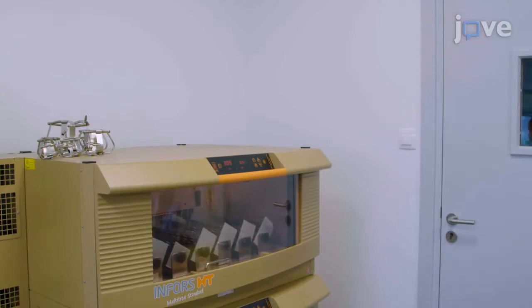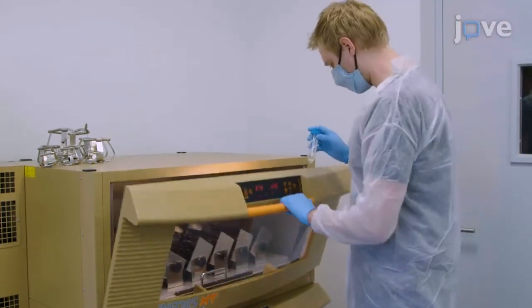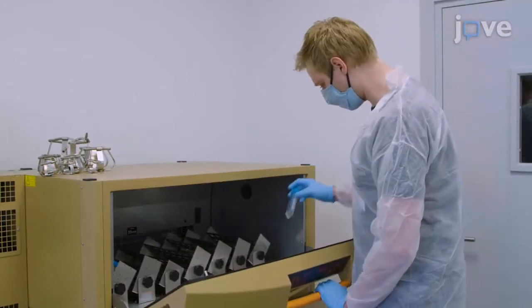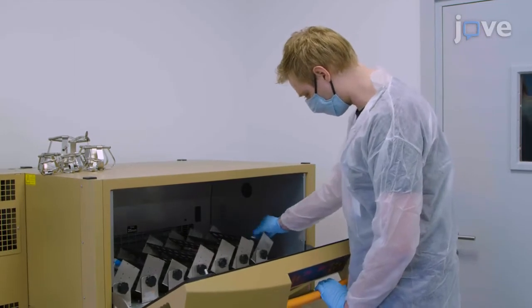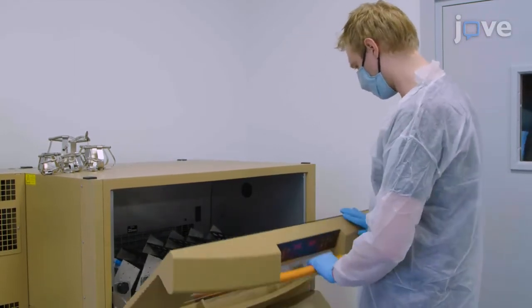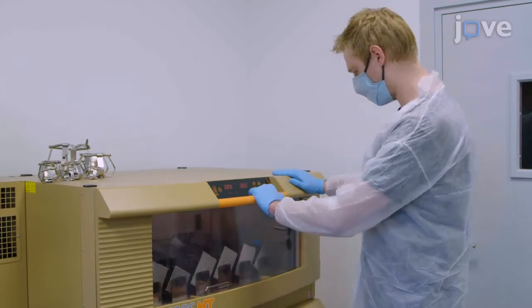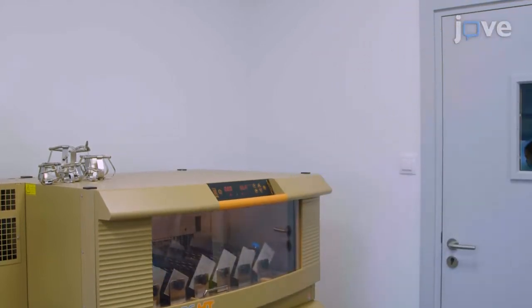Begin by growing P. aeruginosa, E. coli Top 10, and E. coli helper bacteria, each in 5 milliliters of LB without antibiotic, at 30 degrees Celsius while shaking overnight.